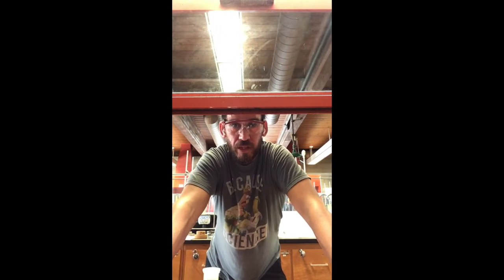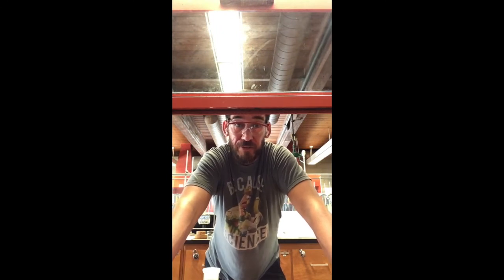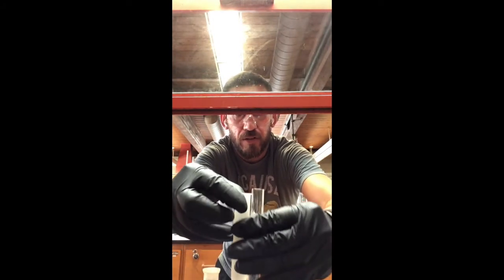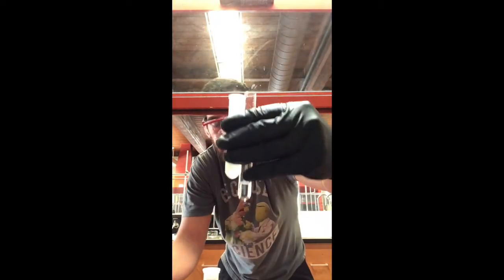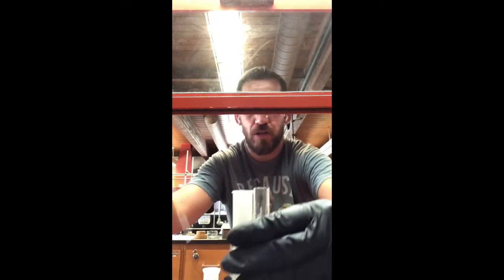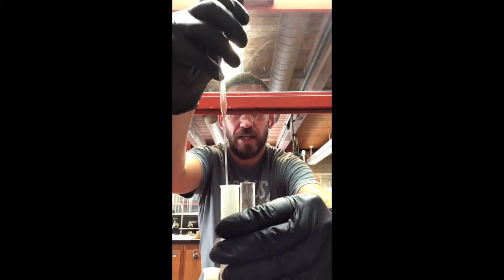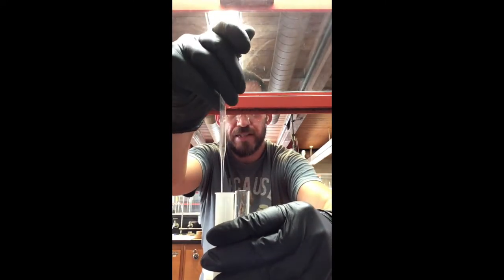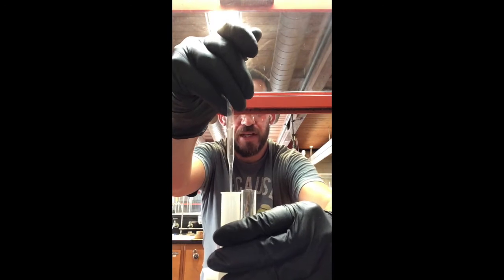And we're back. Okay, so we've got, actually that's not a break for you guys. We're just cutting straight to it. That was a little break while we let this settle. We've got nice clear 2 layers, and so we're going to hold these 2 together like that. We are going to transfer the organic layer, squeezing the bulb, now placing inside of the liquid.